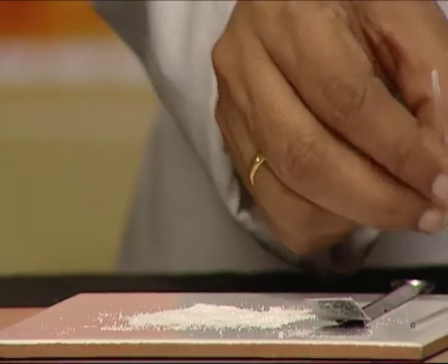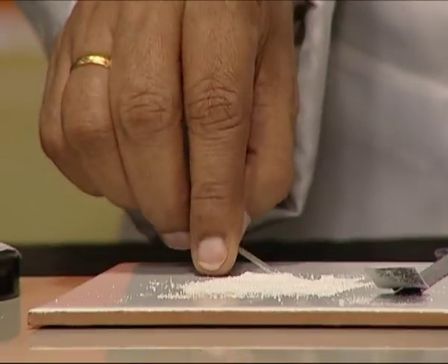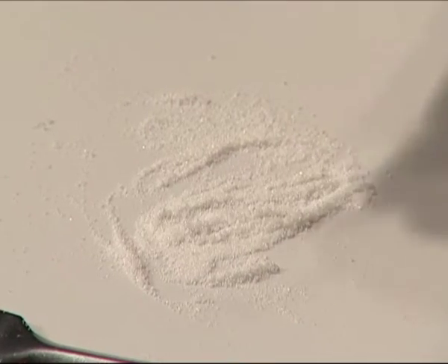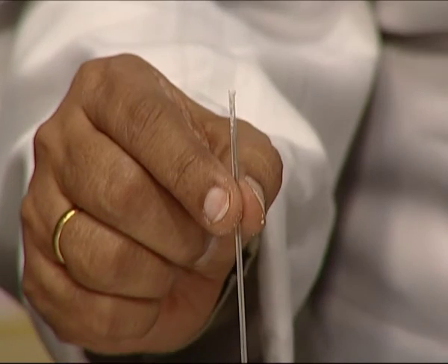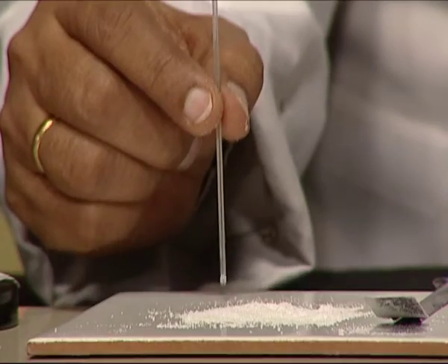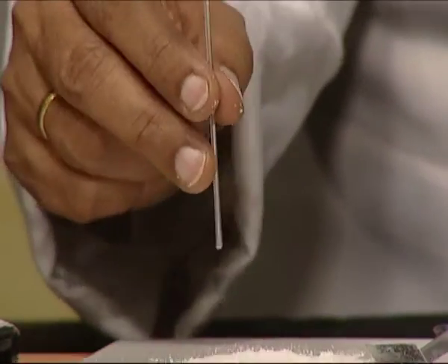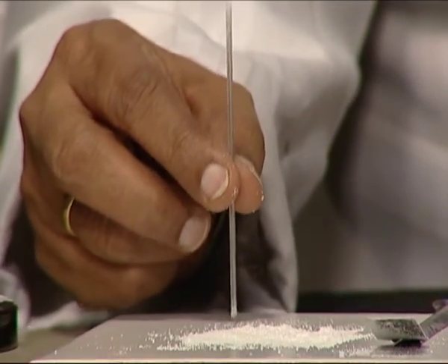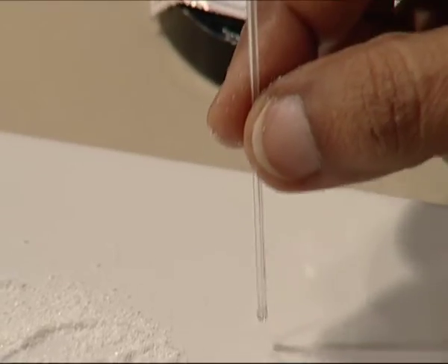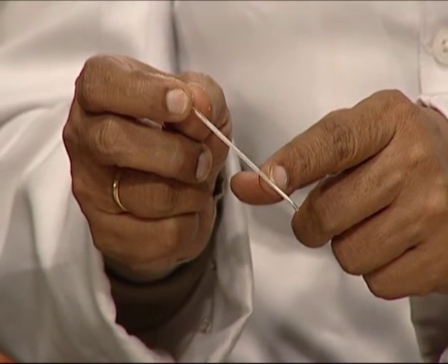We will fill the organic compound into the capillary tube by pushing it against the compound. Care should be taken to loosely hold the tube between the index finger and thumb and gently tap it. We will repeat the procedure until about 1 cm of the tube is filled with the organic compound.